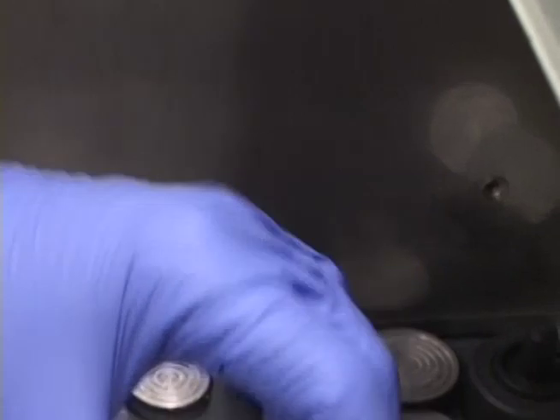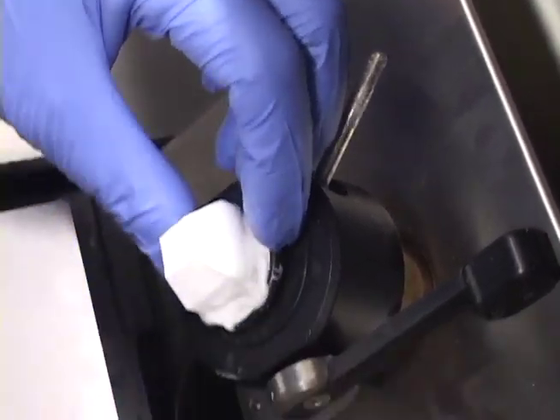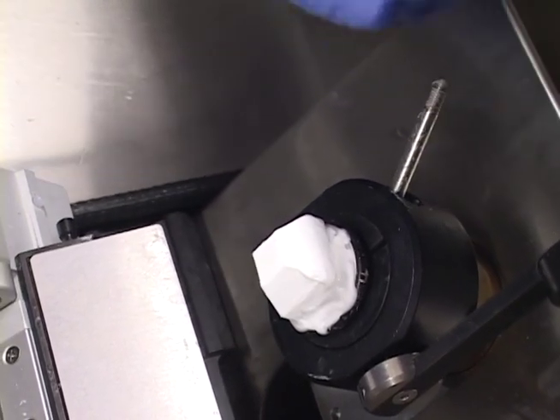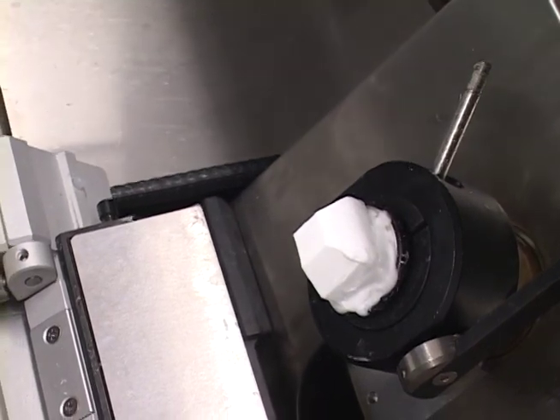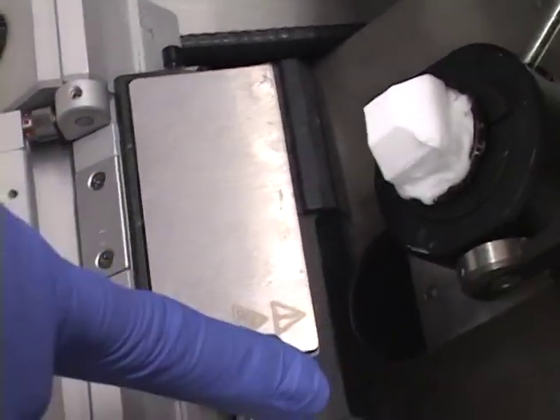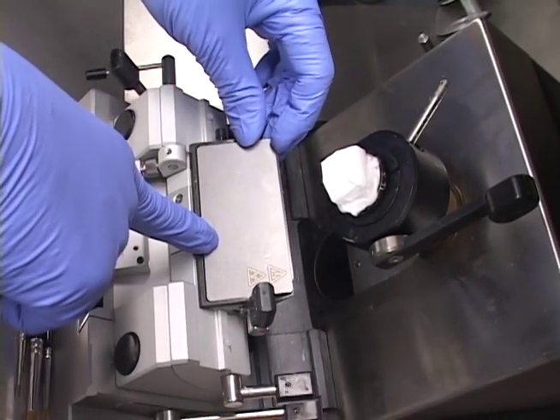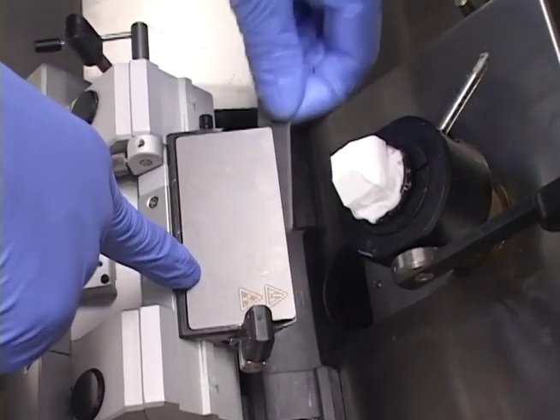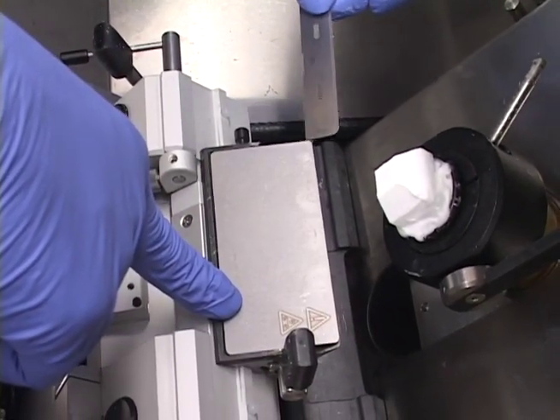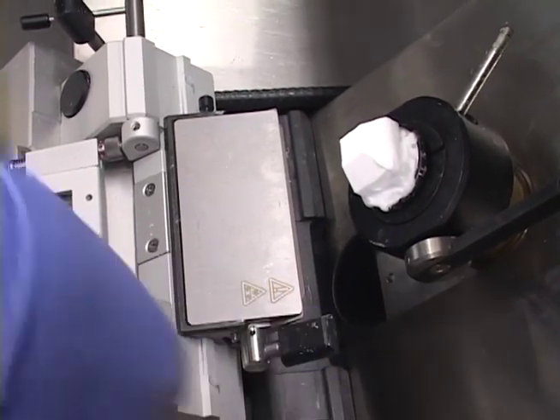To mount our tissue that's frozen enough, you put it in the chuck — this loosens it, you slide it in. Try and get it as evenly perpendicular with the blade as you can, and then you turn this. You don't need to crank it tight — just a little finger tightening is good enough. Our microtome holder is unusual in that you have to actually press this plate on the knife holder to slide the knife in. We use high profile blades on here. If a blade gets stuck past the lip, use another blade to push it out — don't use fingers if you can avoid it. Clamp it with a gentle thumb push.